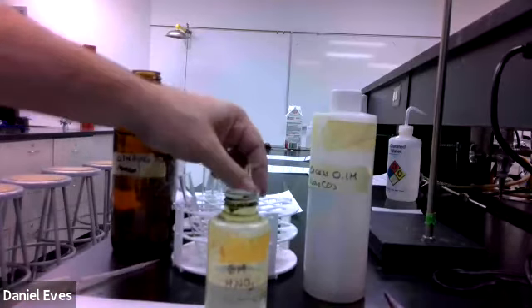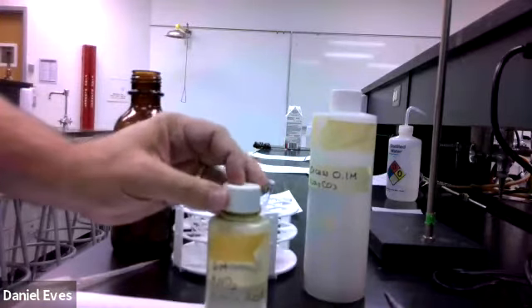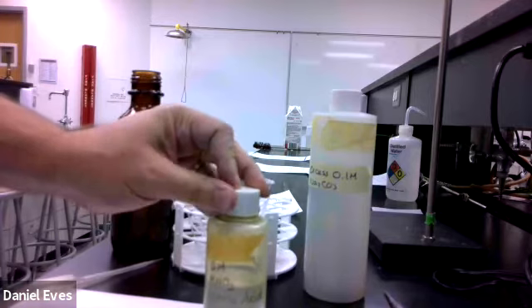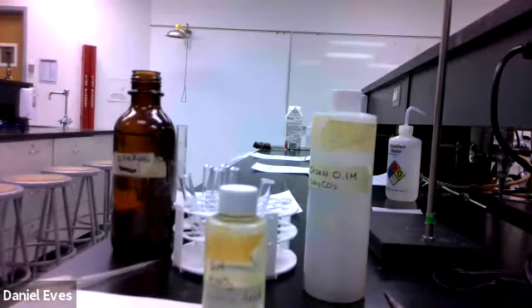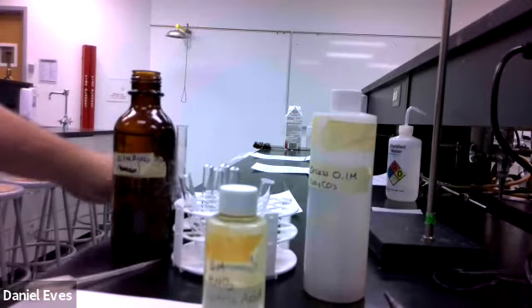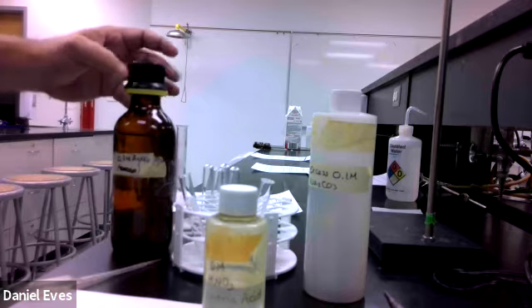Now, what reacted with the nitric acid? Was it everything in the solution, or was it just the parts of the solid? That is an excellent question. We know for sure carbonate did because we had bubbles made. And what was connected to the carbonate? Hopefully you figured that out.